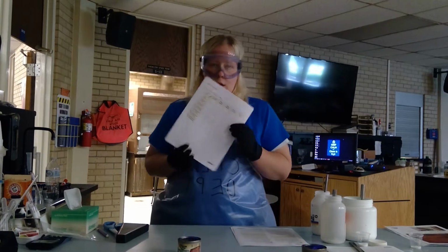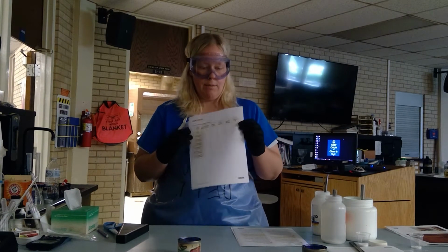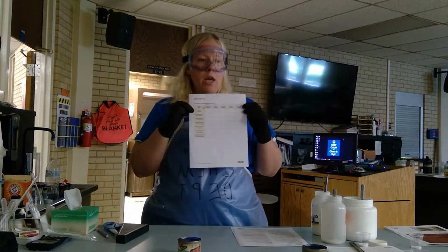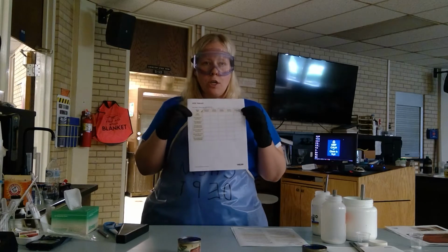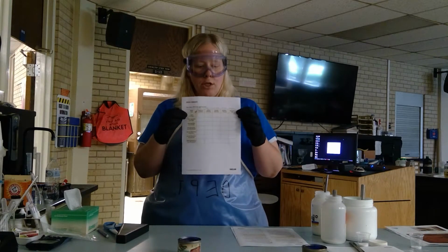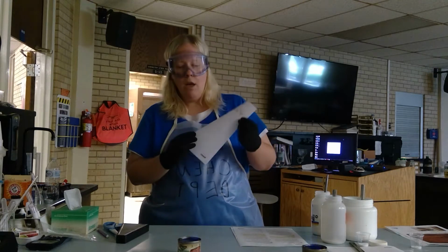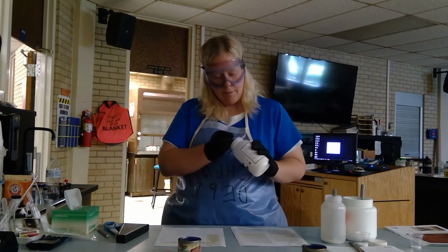You need to have data table 3 in front of you to complete this experiment. The part up here, color of the flame: you're going to be watching this video, and you're going to note that I'm going to do flame tests on 5 different substances. You're going to note the flame color for each one. For each of those substances, you will then take that flame color, do some research, and come back to this table and identify what substance it will be.